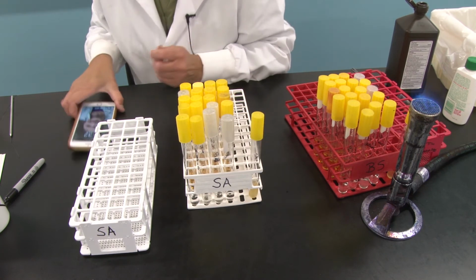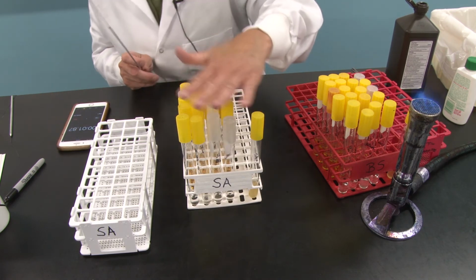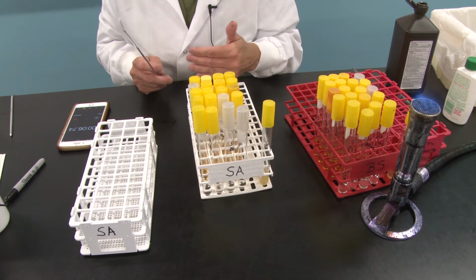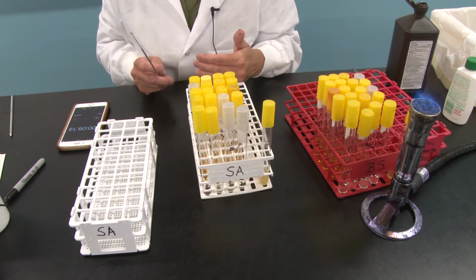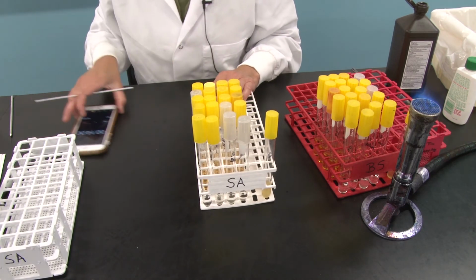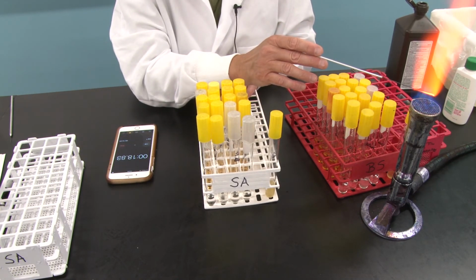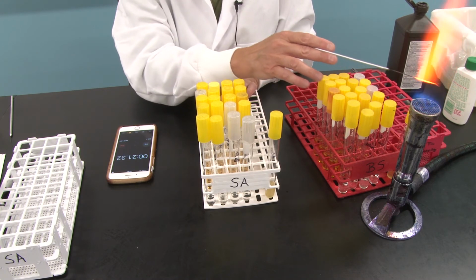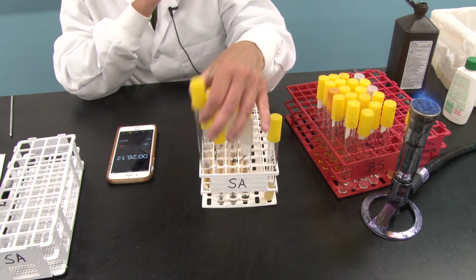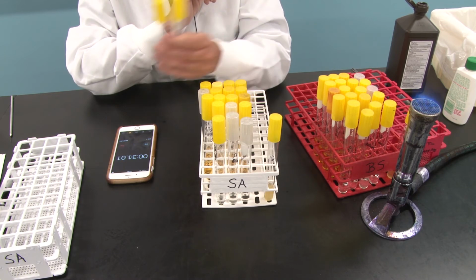I'm going to start my 1 minute. I realize it is a little bit more than a minute from when I started inoculating it, but we're all going to do these the same, and we're assuming that the amount of time it takes me to do the transfer is roughly equal each time. Okay, so we're going to wait and watch. In 1 minute's time, I'm going to have my loop ready, sterile, ready to go. And in 1 minute, I'm going to move a loopful of this tube into this tube. So I'm just going to have it ready to go.